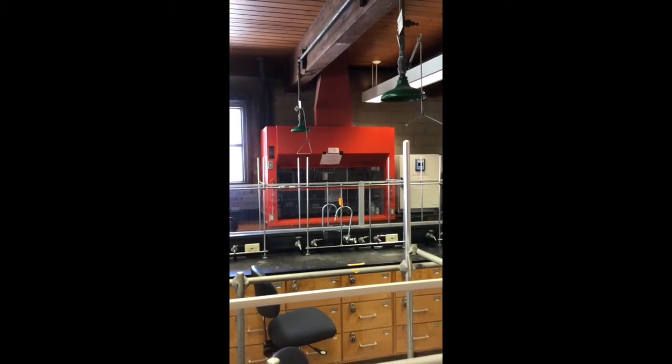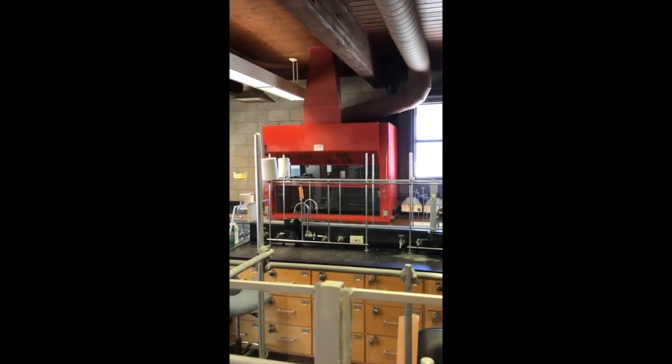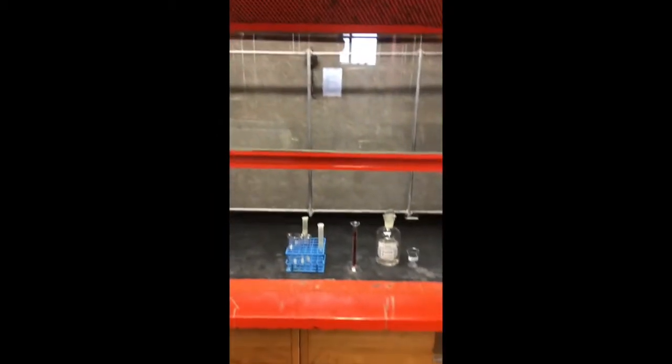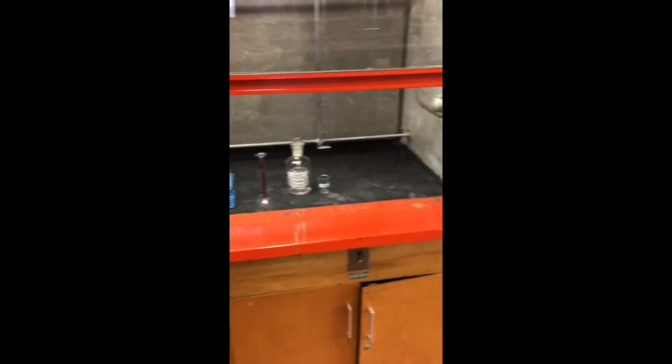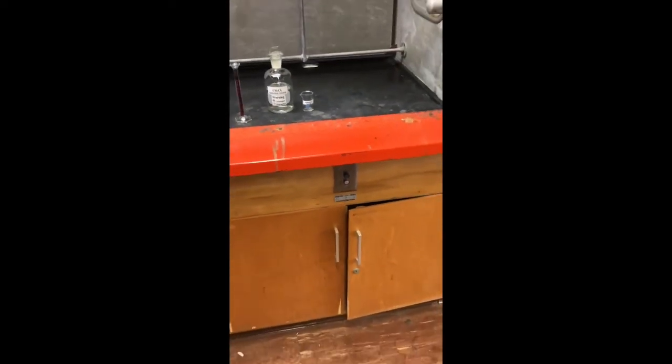So let's check out the hood. I'll introduce a couple features of it that you need to be aware of, okay? All right, just to show you a hood from far away. That's the hood. We've got this lone one right here that's white, and then another orange one. So here we go. Here's some chemicals. We got our methylene chloride for the next step of the extraction. You see this guy right down here? That top button turns the hood on, the bottom button turns it off.